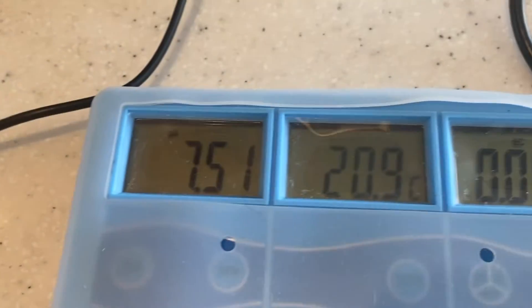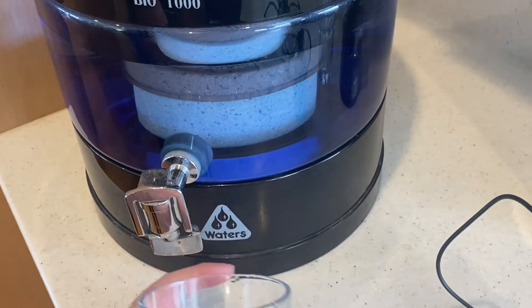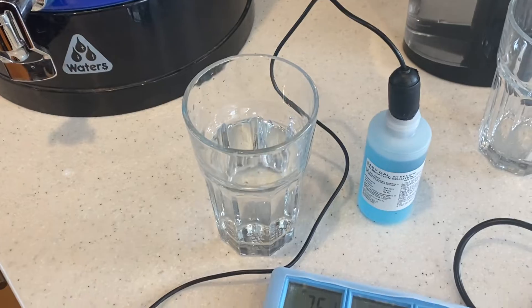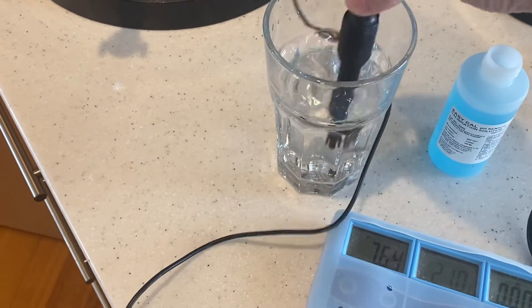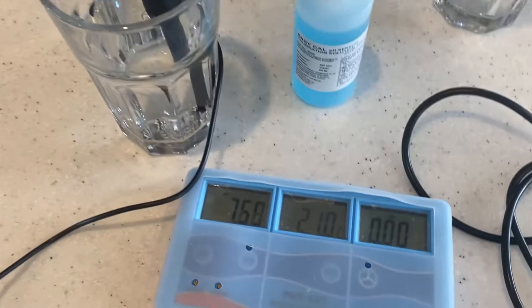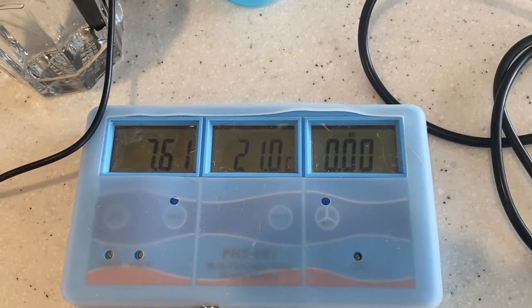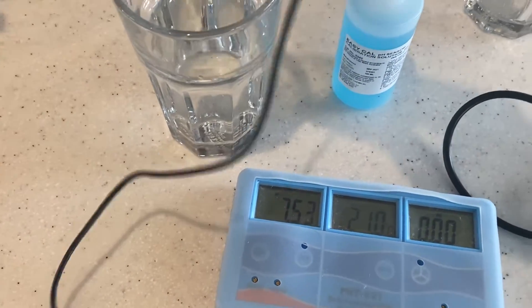We're going to test the Bio 1000 10-litre system. This will generally give a pH of around 7.4 to 8.2 — that's what it's designed to do, because you shouldn't be drinking highly alkaline water all the time. We'll remove the solution and put the tester in there. We can see it's coming up at pretty much 7.6, so definitely not acidic, slightly alkaline, not too alkaline.